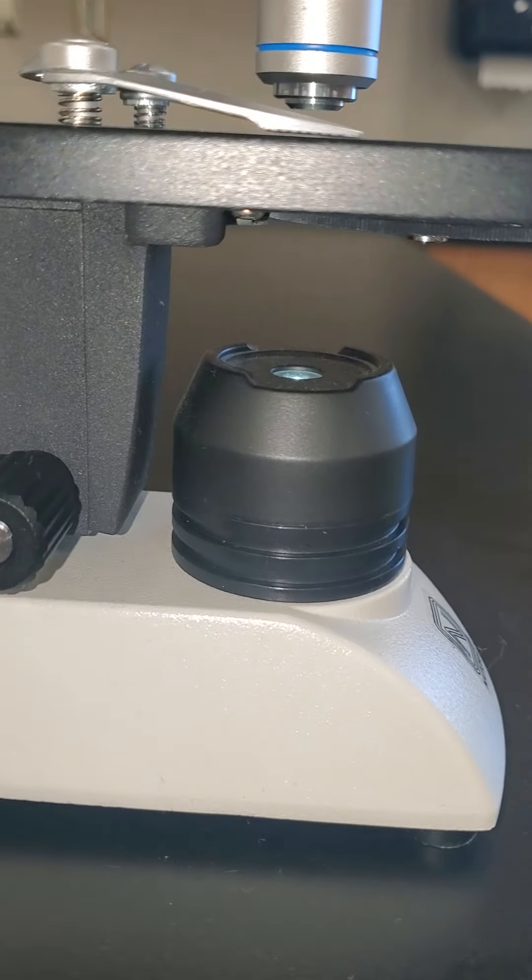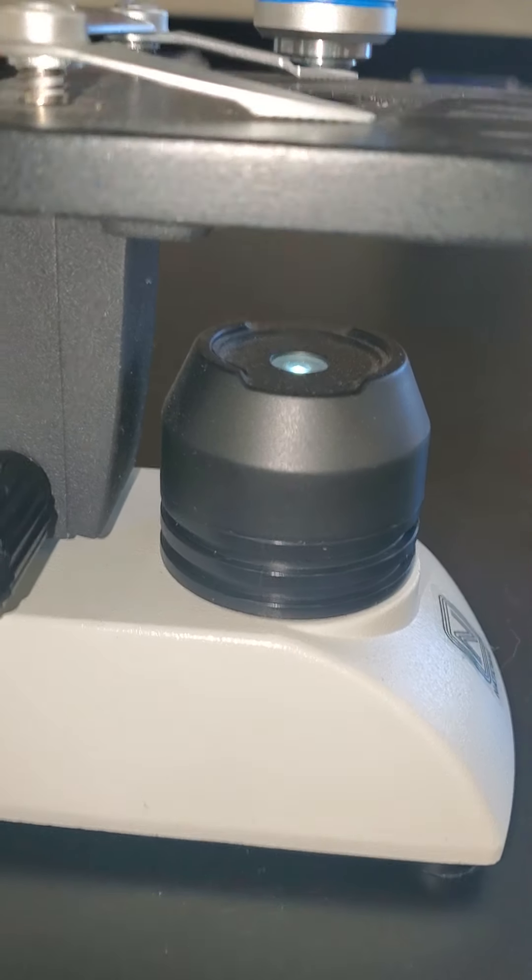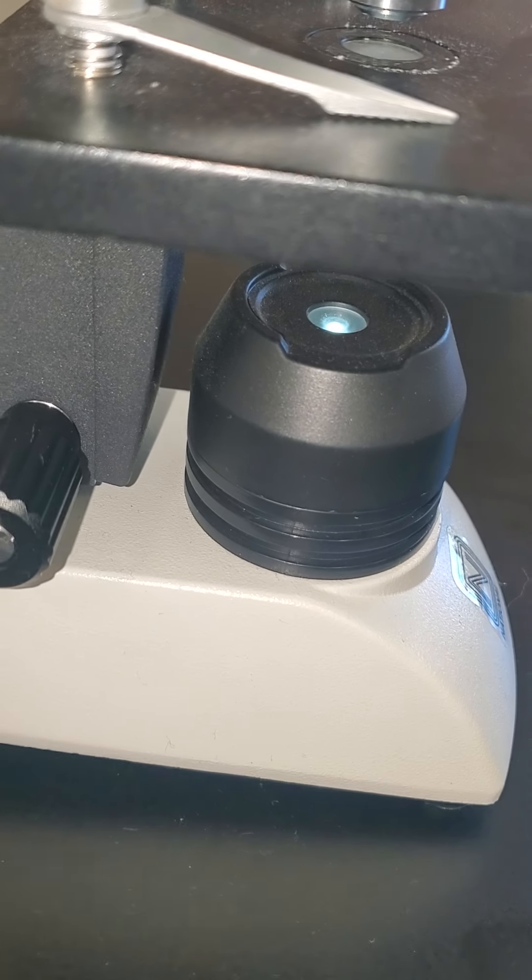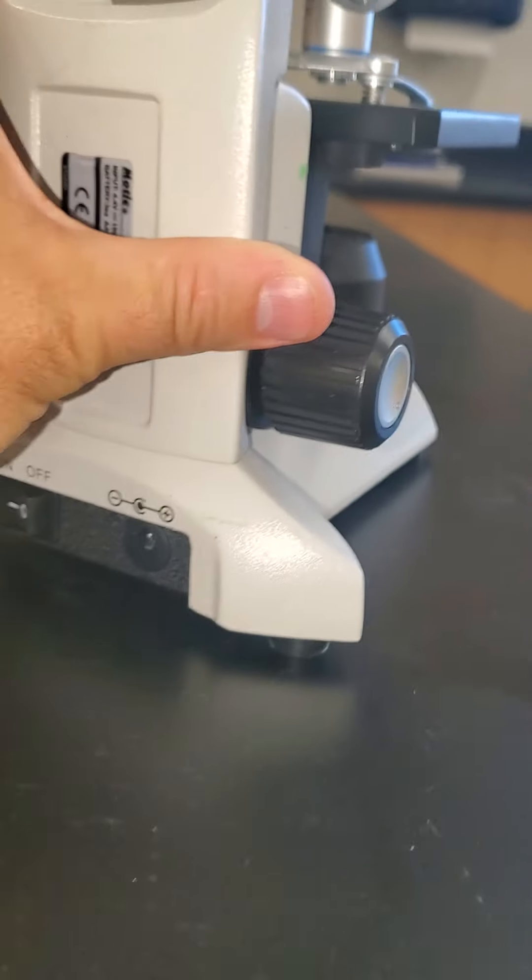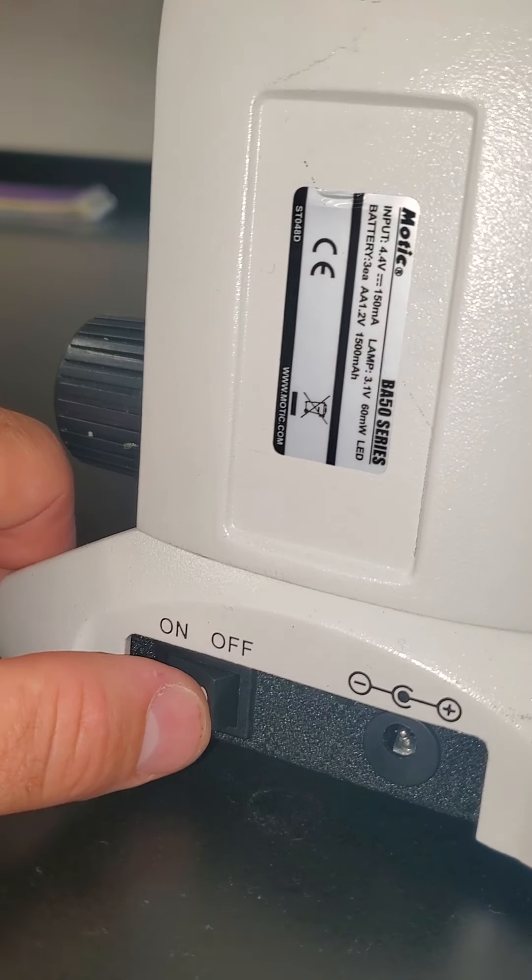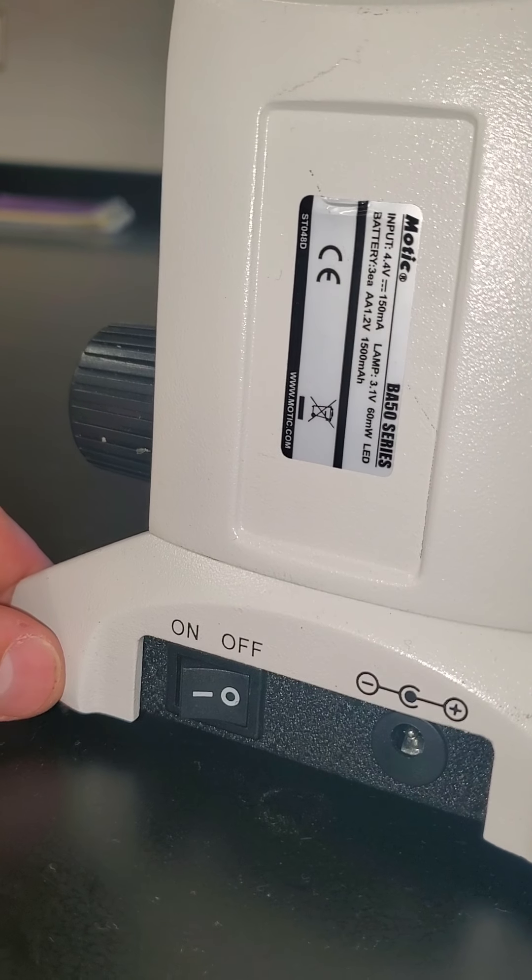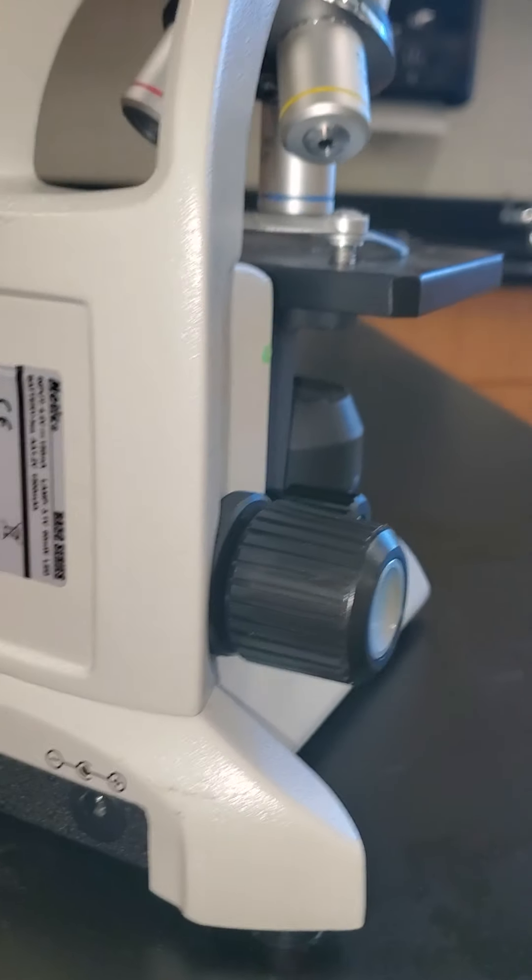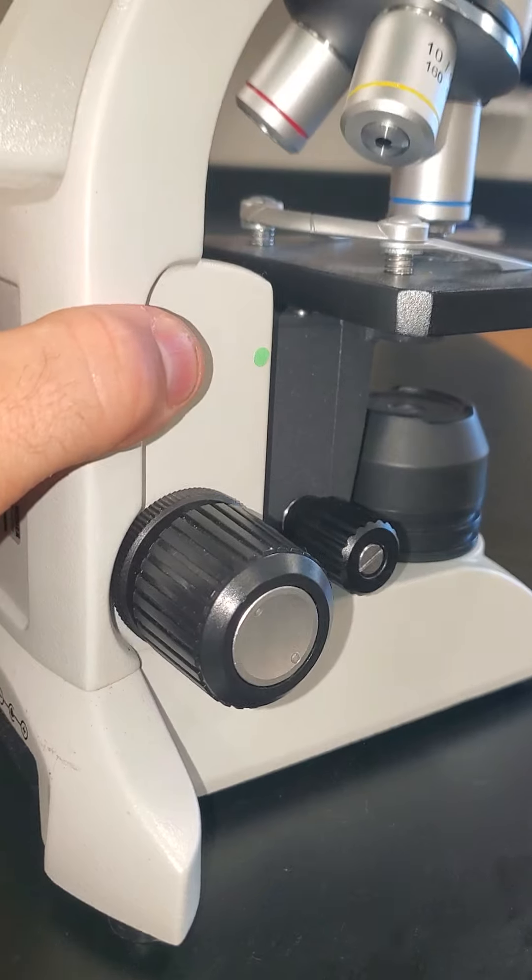There is a light on the microscope down below. You can see that that's shining, and on the back of the microscope there is a switch for on and off. Of course for the sake of reusing these when we are done, that's something we have to make sure we turn off so that the light is no longer lit to save batteries.